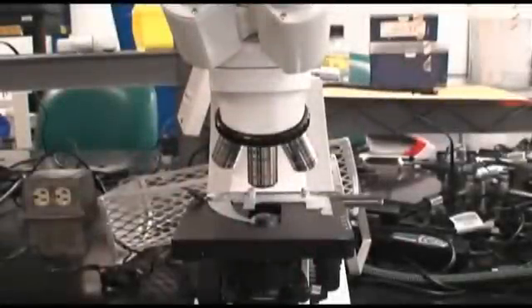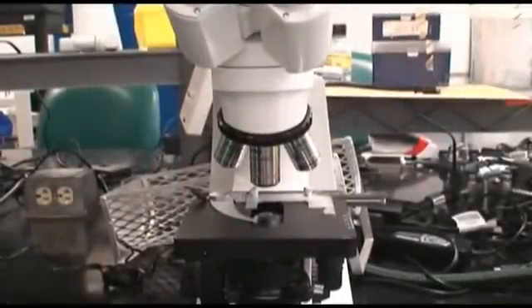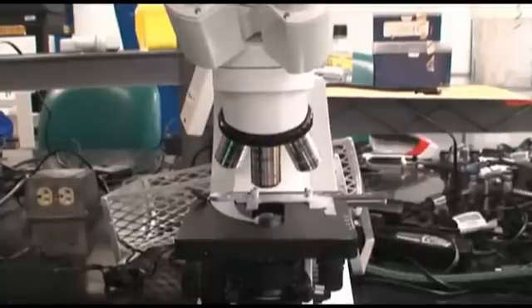Now it is time to view the bacteria using the microscope. If unfamiliar with the proper use and function of the microscope, review the video How to Use a Microscope.